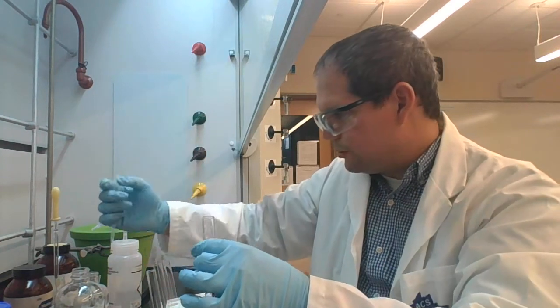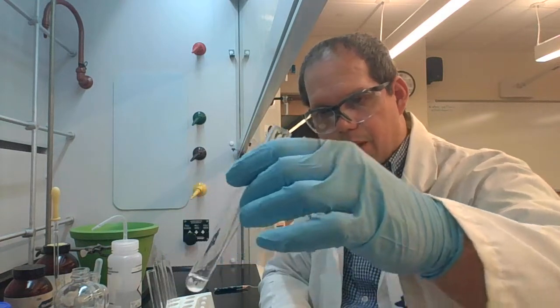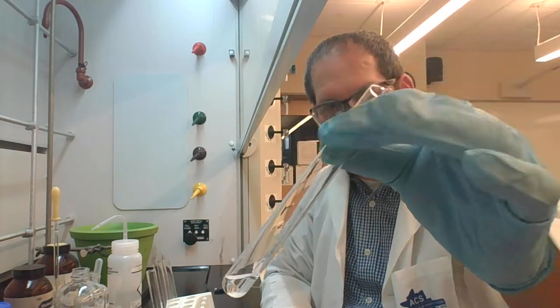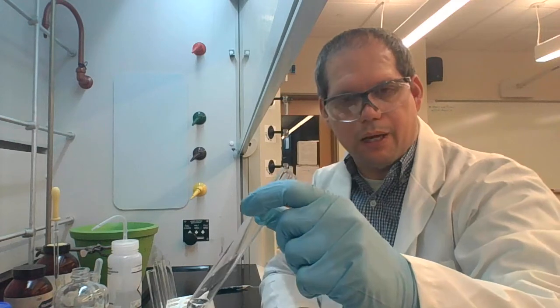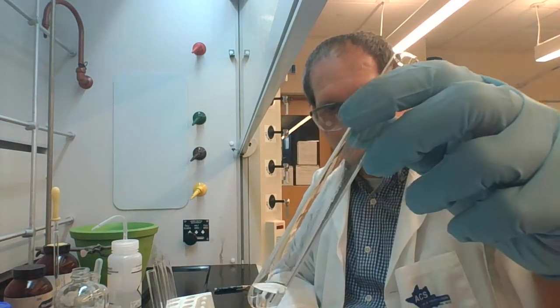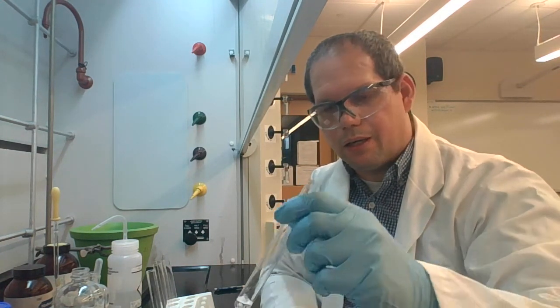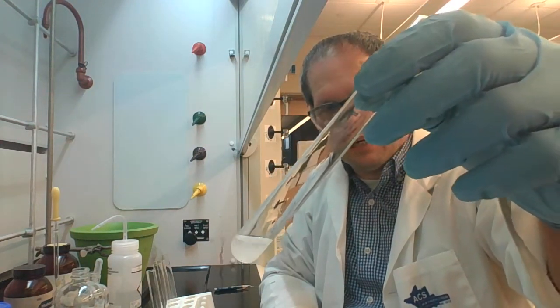So whenever you use these pipettes, whether plastic or glass, we want to be careful that we don't touch anything that is already in this container, whether it's a test tube or any other container, so that when we place it back, if we are placing it back, we don't contaminate that bottle. If you think that you have contaminated the pipette, you want to discard it so that the next person does not use it.